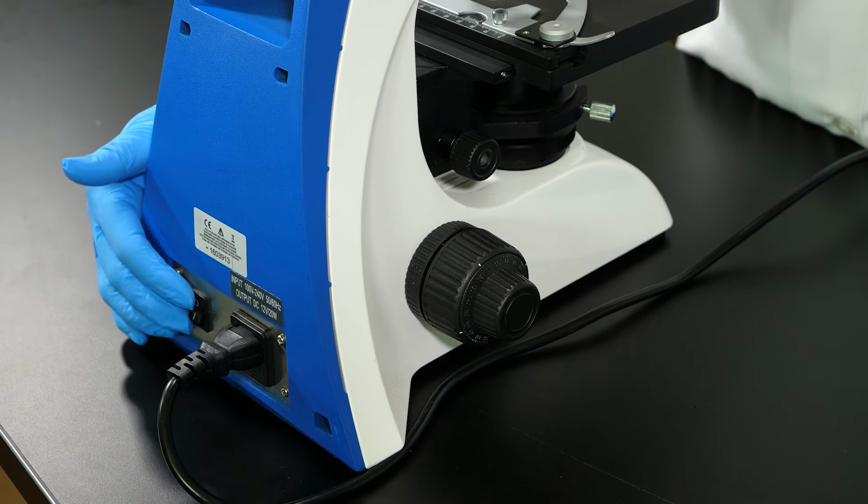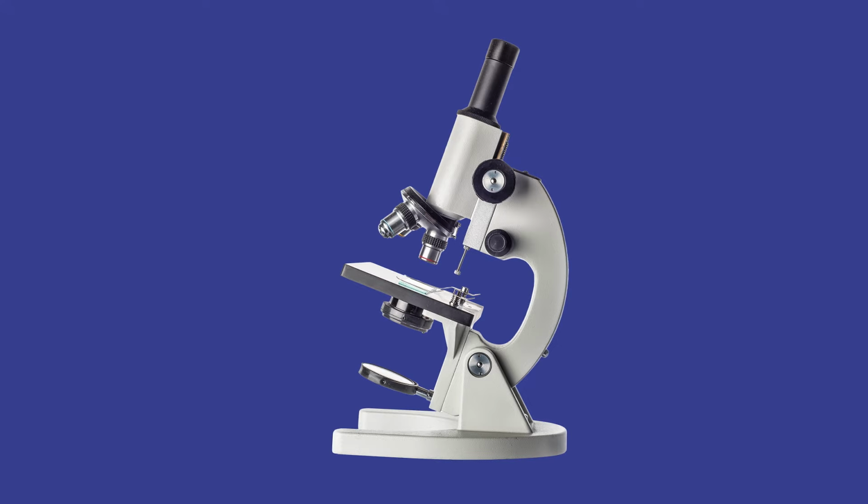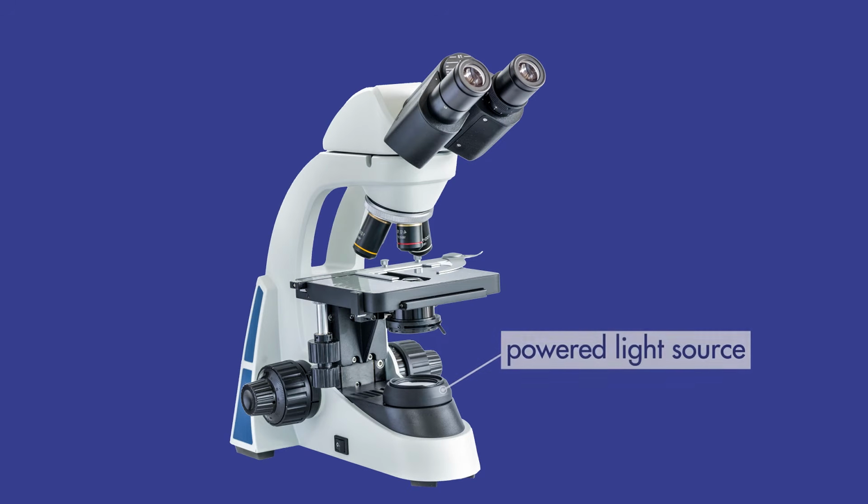The base of the microscope contains the light source. Some compound microscopes use a mirror to focus light from an outside source up through the aperture in the stage. However, most modern compound microscopes have powered light sources.